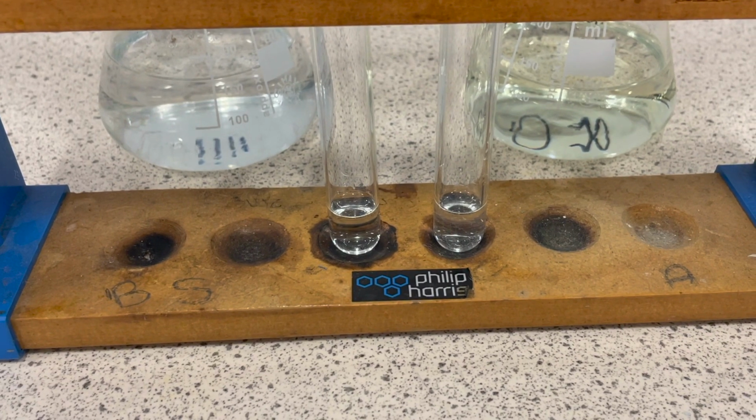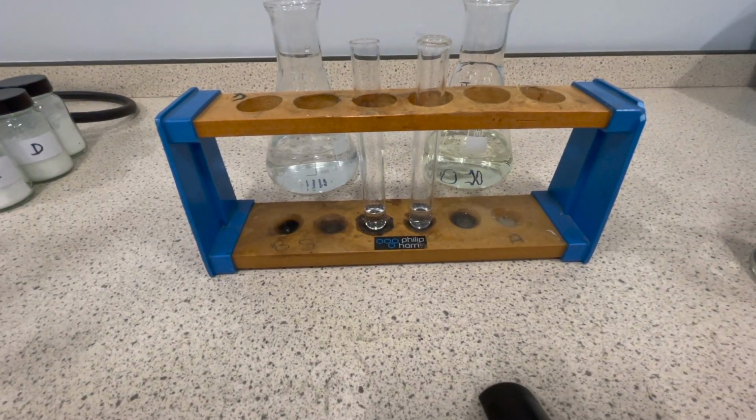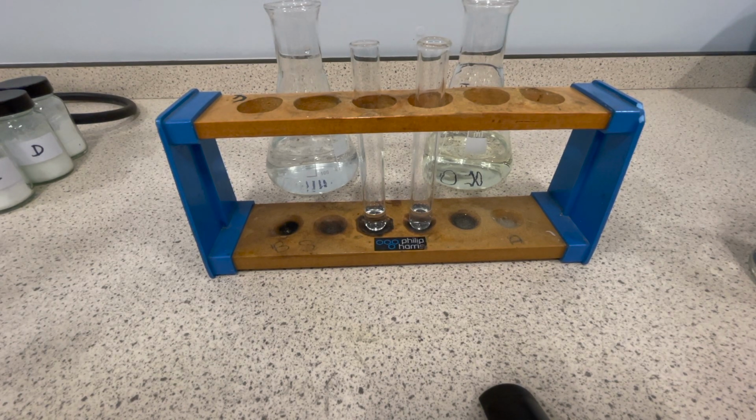Now, in order to test for sulfates, much like the test for halides, we first need to add an acid to remove any carbonates, okay? Because otherwise we get a false positive result here. But I'm not going to use sulfuric acid, otherwise that would put sulfates in the solution. So I can't use sulfuric acid, or I'm placing sulfates there when I'm testing for sulfates. So of course I'll find sulfates.